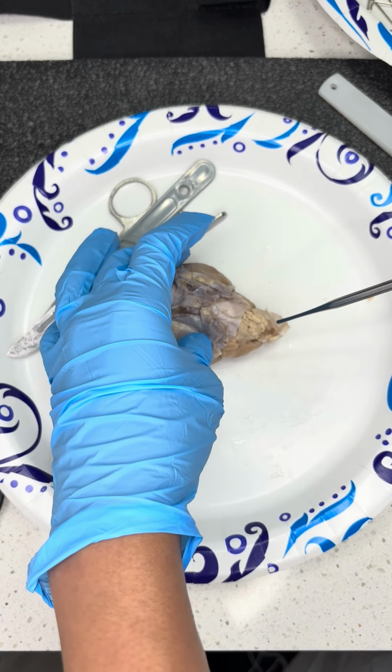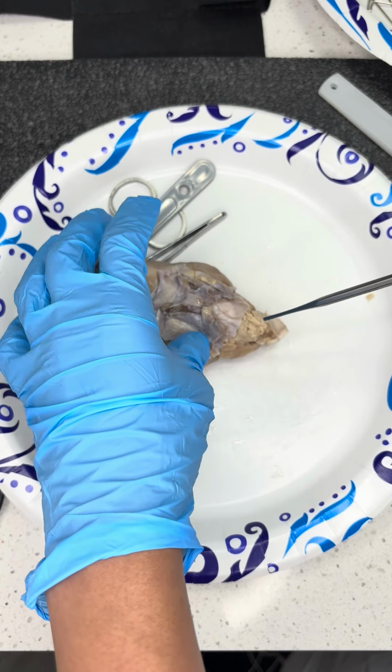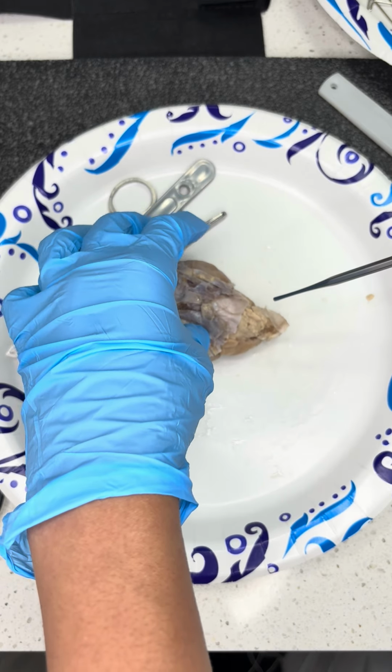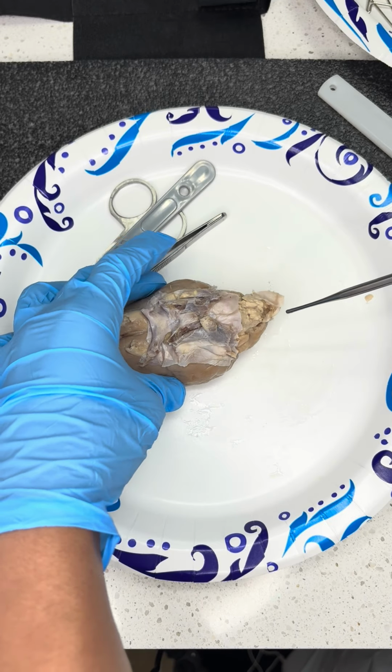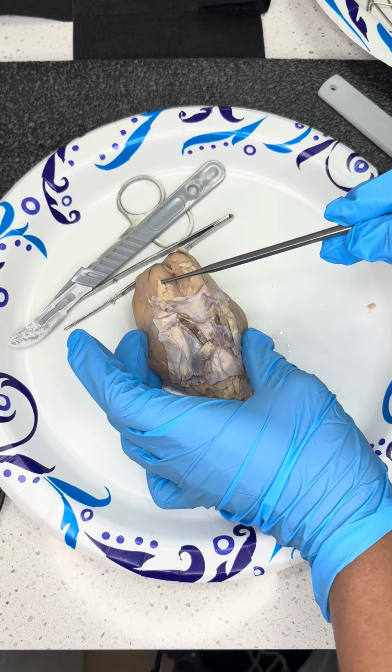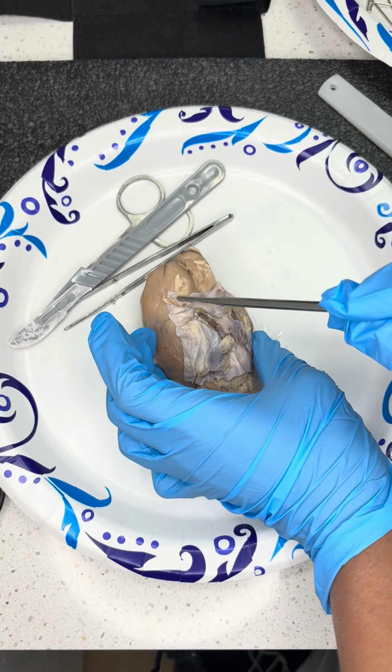Then we have, I've already done the cerebellum. Sorry, I'm reading my list. Just want to make sure I stay on track with everything. Olfactory, I already did the olfactory bulb. I want to make sure I did the tract, which, like I said, falls along there.